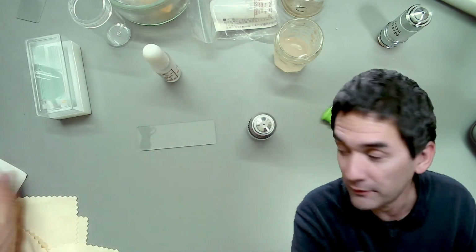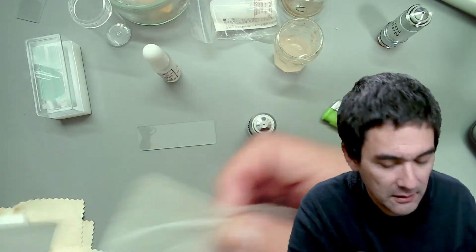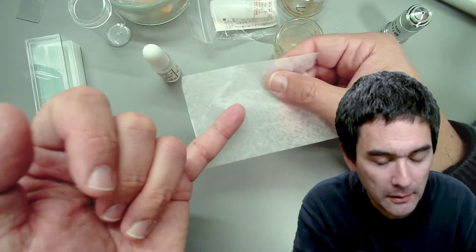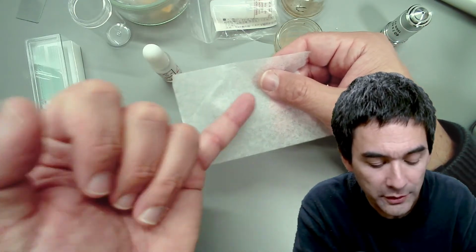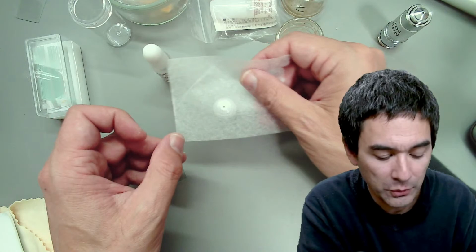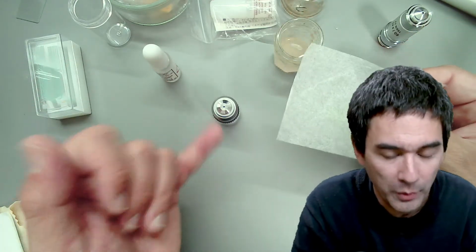What you do, I don't have the solvent with me now, is you basically take a tissue paper. You place the lens here, and you do not apply it directly on here, but you apply the cleaning solution on the tissue paper, and you pull it over like this, okay? And you keep on doing this, and this is how you clean it. So basically, you try to remove anything on here without pressure.